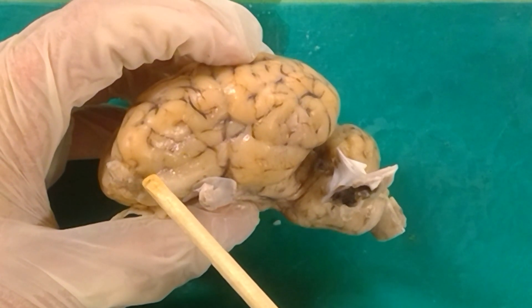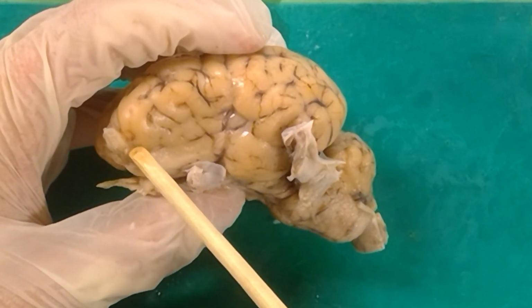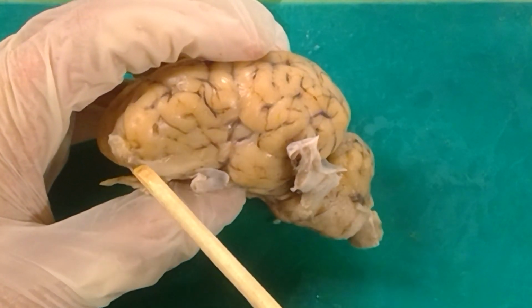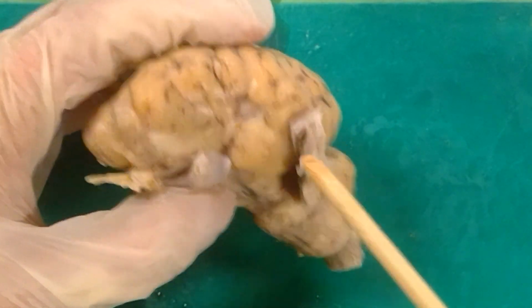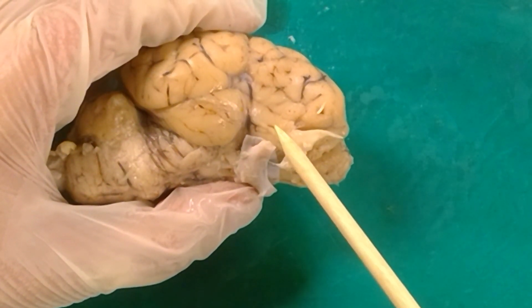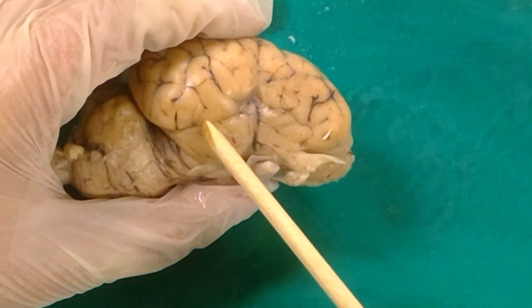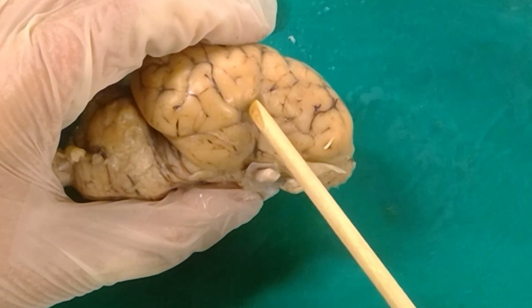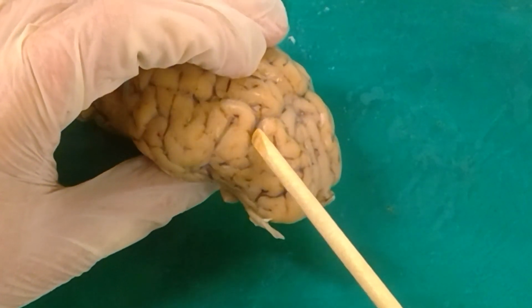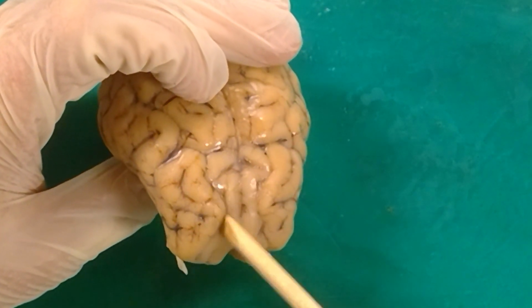Now, if we're looking at the side of the brain from this lateral view, remember this was the lateral olfactory gyrus, and the fissure that's providing one edge of that bump is known as the rhinal fissure. You can see it over here on this side as well. So there's our lateral olfactory stria. This is the lateral olfactory gyrus right here, and this fissure running along right here is the rhinal fissure. Just above the rhinal fissure is where we find the insula, and the sulcus running through the insula is the Sylvian sulcus. We can jump over this gyrus to get back to that cruciate fissure that runs along the top right here and makes a T with the superior frontal sulcus here.